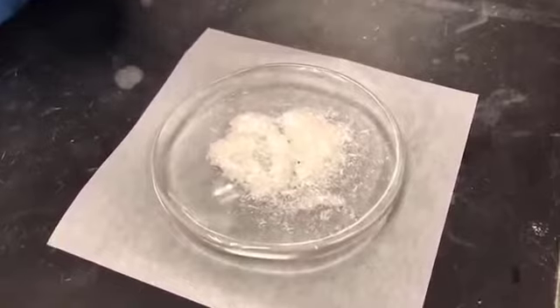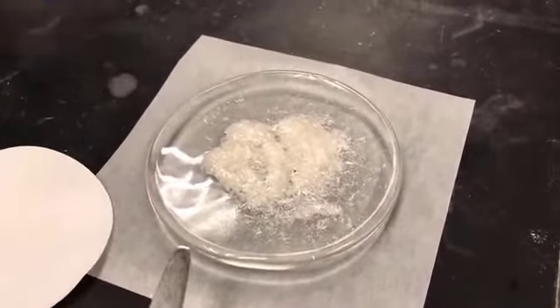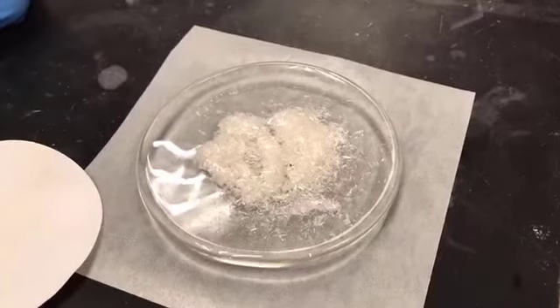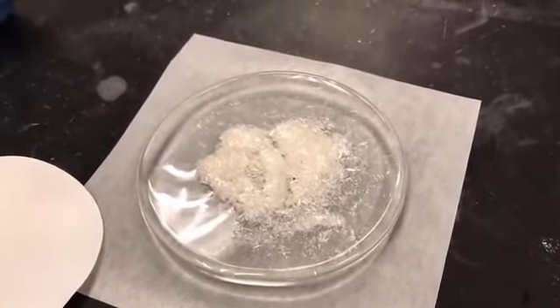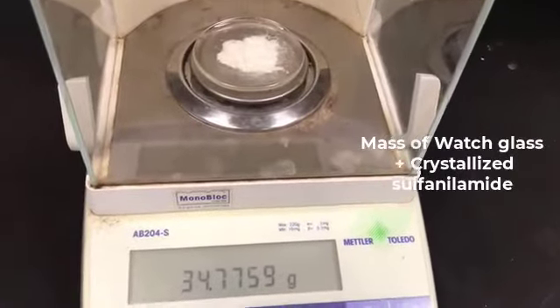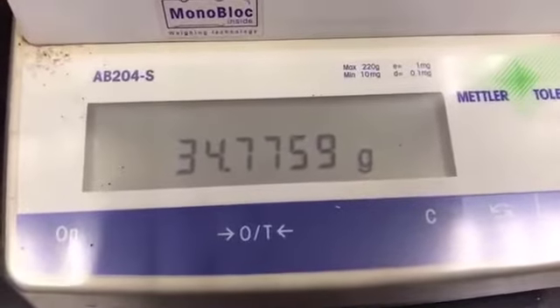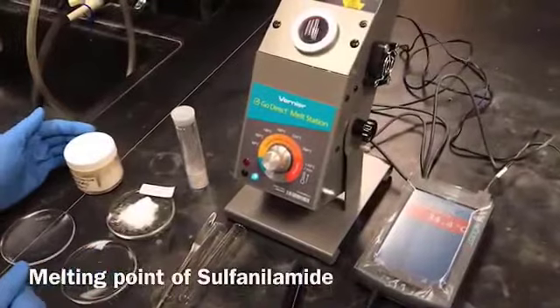So now we will take the mass of this sulfanilamide, and you can just subtract the mass of the watch glass in order to get the actual mass of the crystallized sulfanilamide. So this is the mass of the crystallized sulfanilamide. You need to subtract the mass of the watch glass in order to get only the mass of the crystallized sulfanilamide. So now it's time to record the melting point, right?